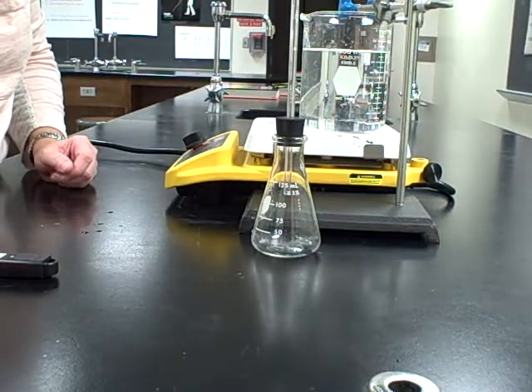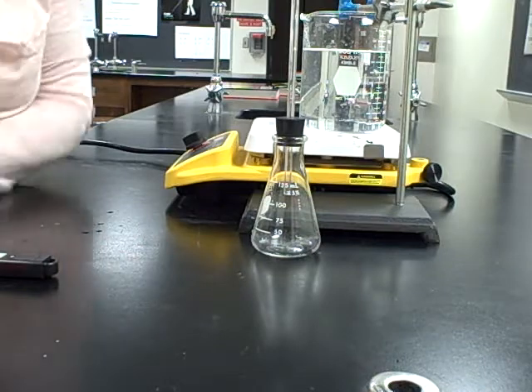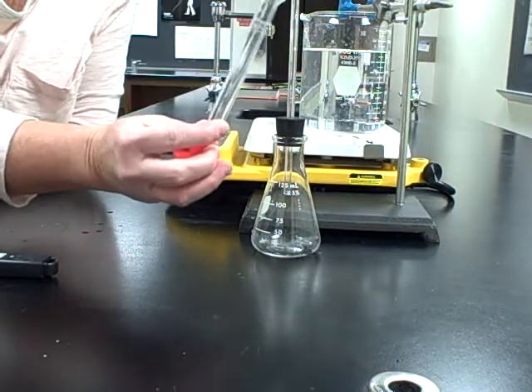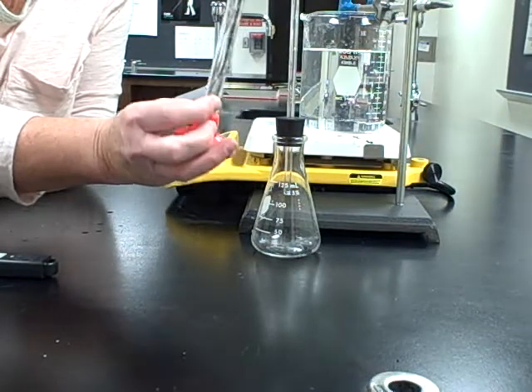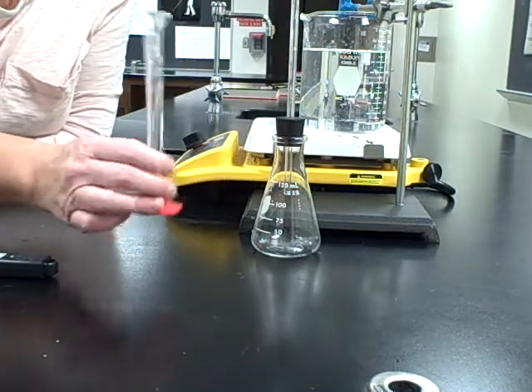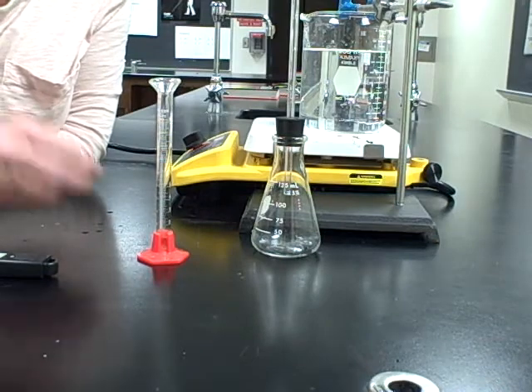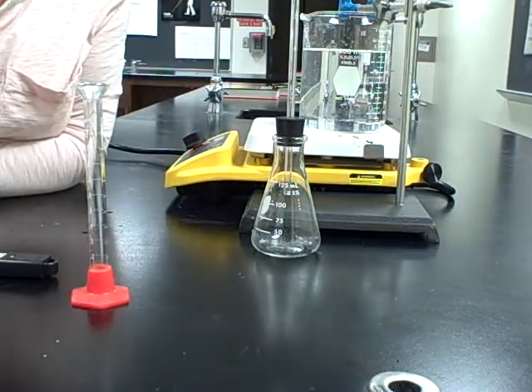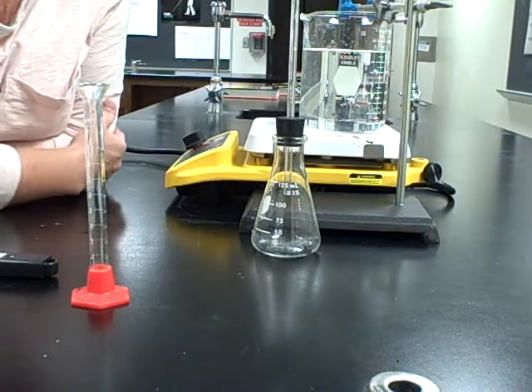Step four says add three milliliters of an unknown volatile liquid to the flask. There'll be a beaker over at the supply table. You should have a 10 milliliter graduated cylinder. Go get three milliliters of this. If you don't have exactly three, it's okay, but make sure you record it to the nearest tenth and have an accurate recording because that will factor into your calculations as well.